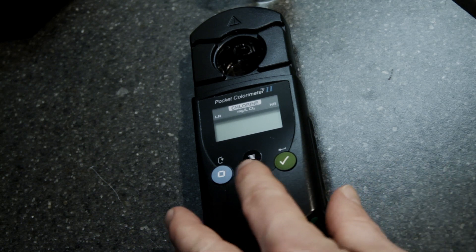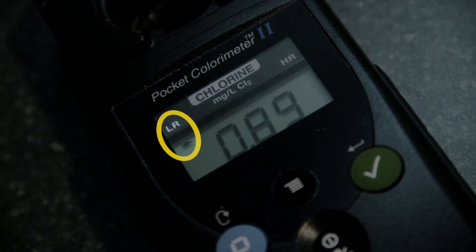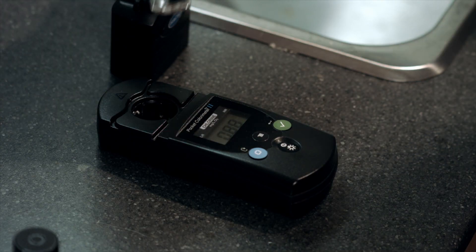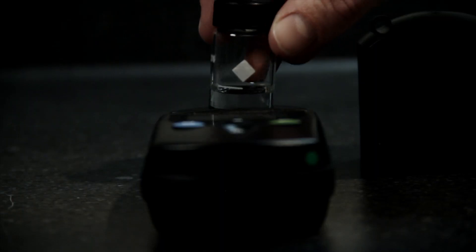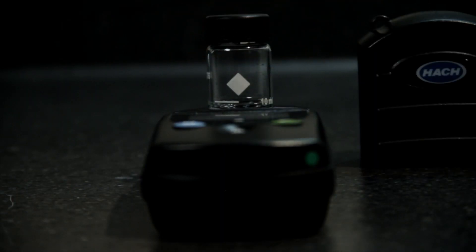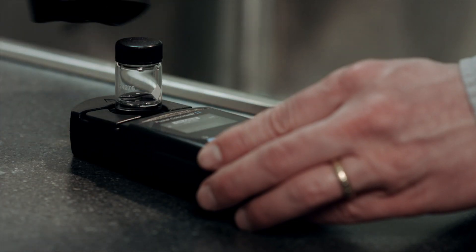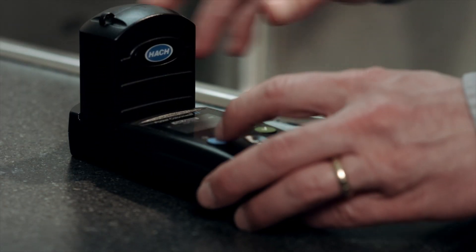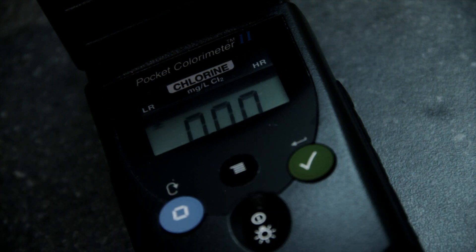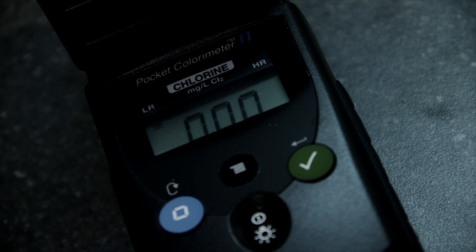Press the power key on your meter. The display screen will illuminate and an arrow should indicate you are in the low range. Insert the sample bottle into the meter with the diamond on the sample bottle facing the keypad. Don't twist the sample bottle once it is in the meter as it may scratch the bottle. Cover the meter with the instrument cap. Press the zero key. The display screen will show 0.00. This ensures the meter has been properly zeroed for your test.